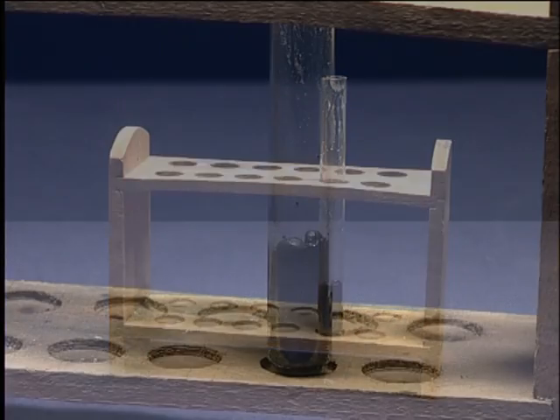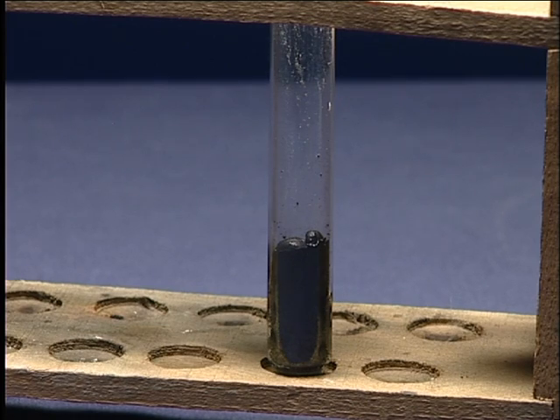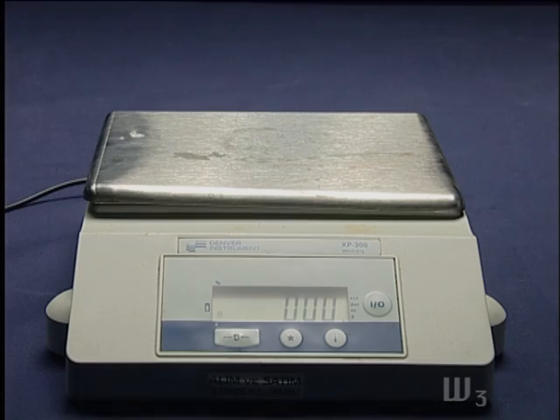Allow the test tube to cool completely and weigh it. Record the result as W3.